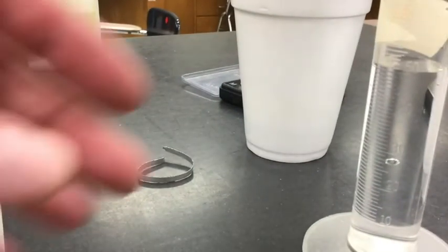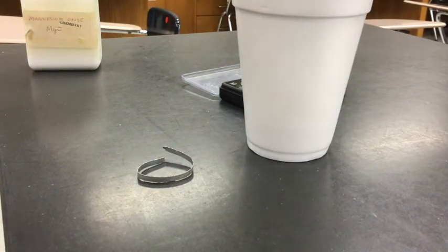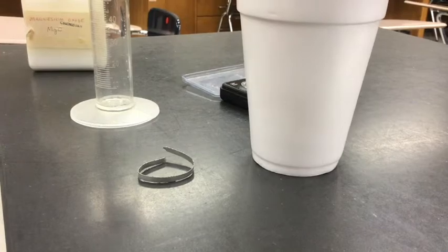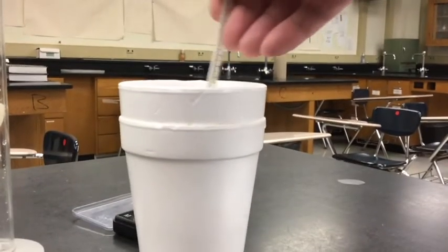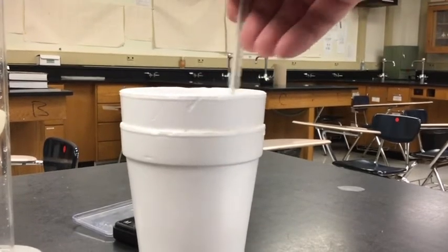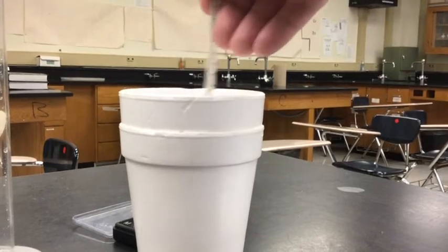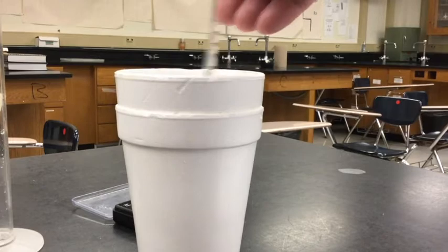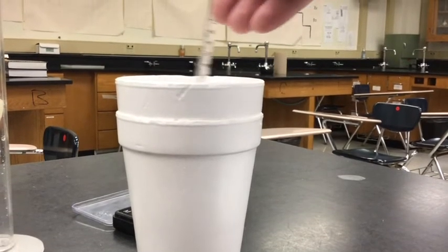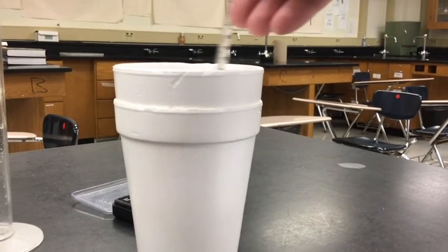So I'm going to go ahead and put our hydrochloric acid into the high-tech calorimeter here, and again I am going to take its temperature so that I know where it is starting. Once again, we're going to cheat. We're going to assume that the hydrochloric acid is mostly water, which it mostly is, but the standard numbers for water are technically not the case here, but we're going to assume that they are, and it's going to get us close at any rate to the specifics.